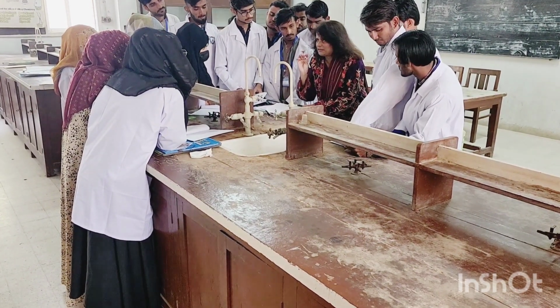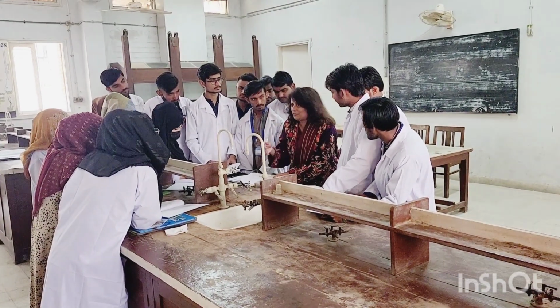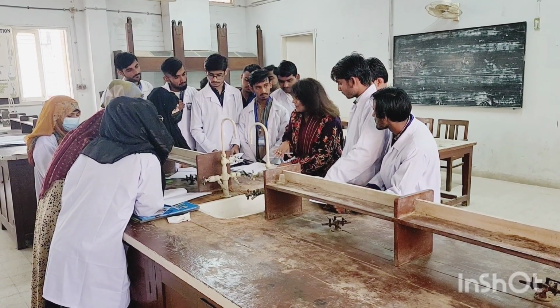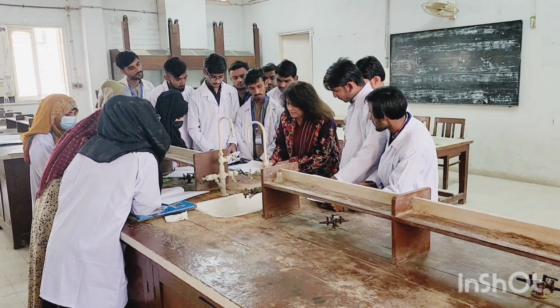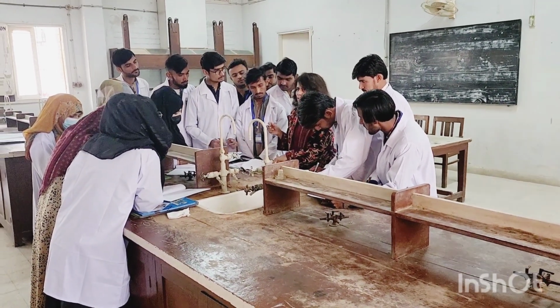Take a small amount of HCl, and every time you have to take 1 ml. That's it, not more than 1 ml, because you are going to discard it. That's why we don't want to waste our chemicals. So you will discard it, wash the test tube, and try the next solvent. Hexane, and then you will use HCl and then sodium hydroxide solution, an acid and a base. This is how you are going to proceed with your solubility test.